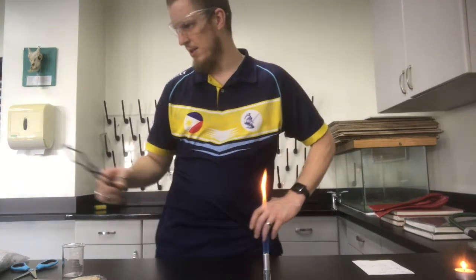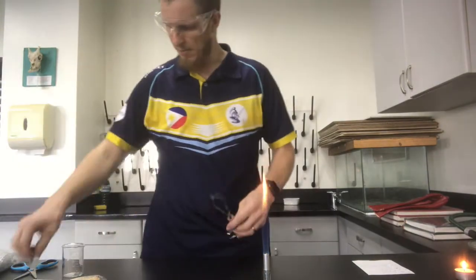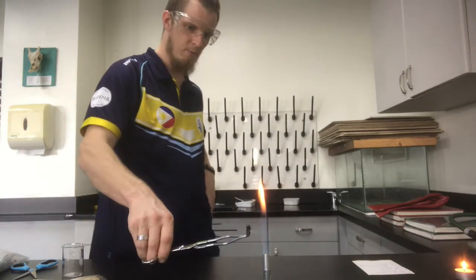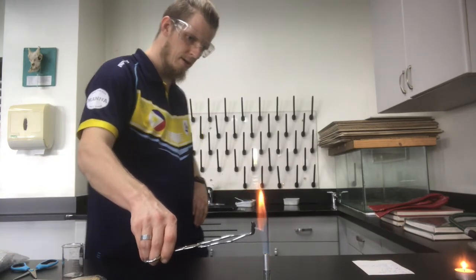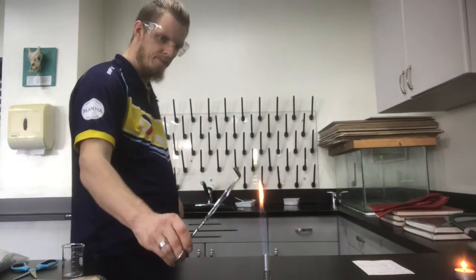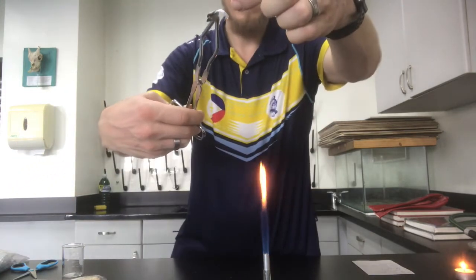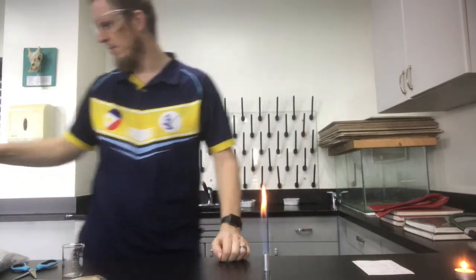But you would have seen there that you had a very bright white flame. Here, I'll do it one more time, and I'll show you so you can see the metal there. It's quite rigid and solid. If we get that in there. There she goes. Really bright white flame. And you can see now that it is twisted and curled. If I just flick that, you'll see that it breaks very easily. It's kind of like ash, and that is the magnesium oxide.